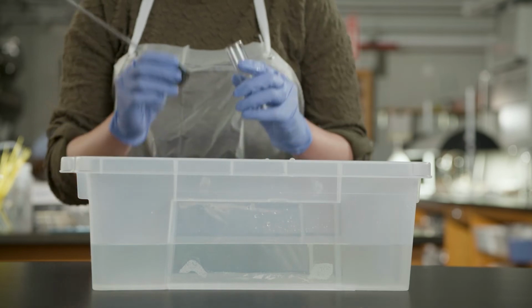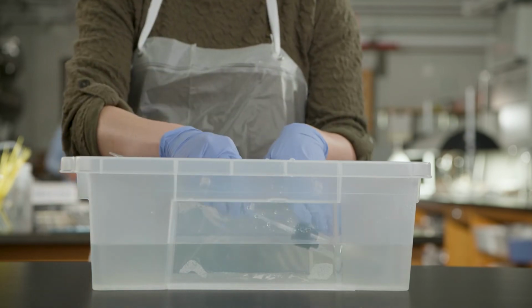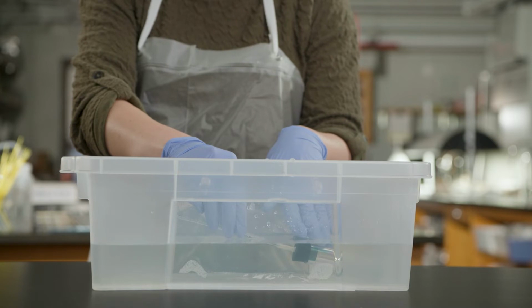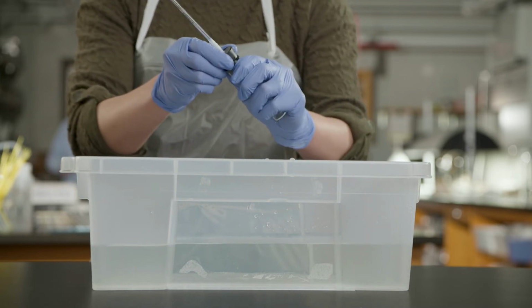To make sure the seal on the stopper is airtight, plug the top of the vial with the stopper and completely submerge the respirometer in the water bath for 20 to 30 seconds and check to see if water is entering the vial. If the vial is leaking, this may be due to poor contact between the stopper and the pipette, or between the stopper and vial. Simply tighten the stopper and/or the pipette to correct this.